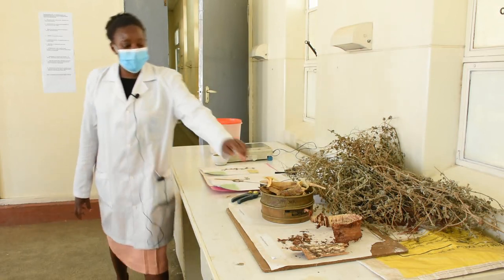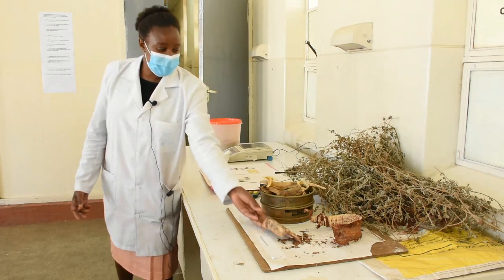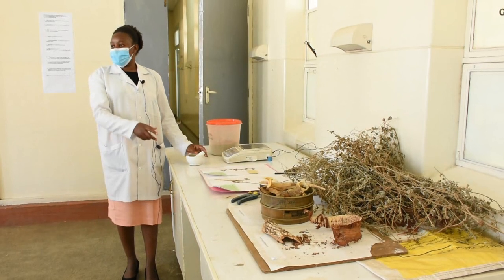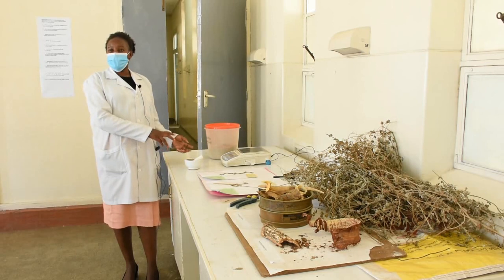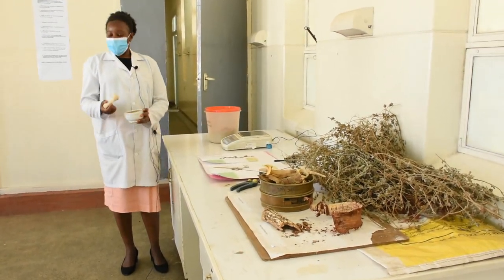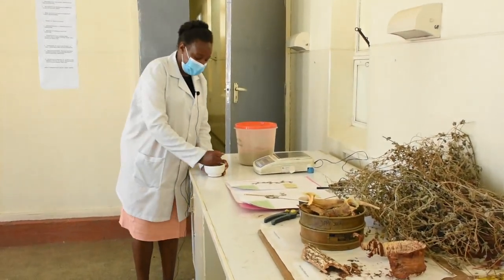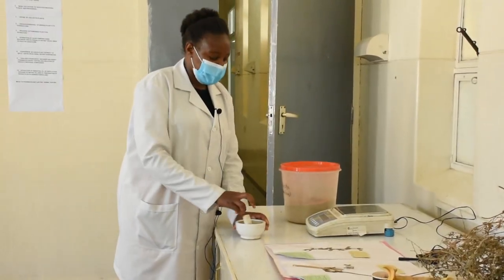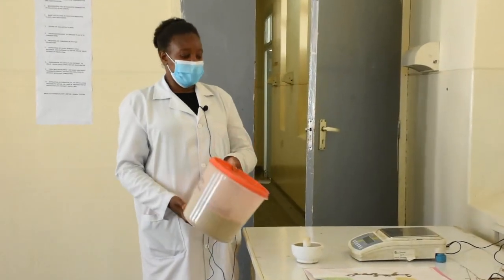These are the barks of a plant — collected, dried, and now cut into pieces. To extract, we have to reduce the size to increase the surface area for interaction of plant material with the extracting solvent. This is the apparatus we use for milling — we grind it to increase the surface area. From a large bulk we get a powder sample, which we have milled here.